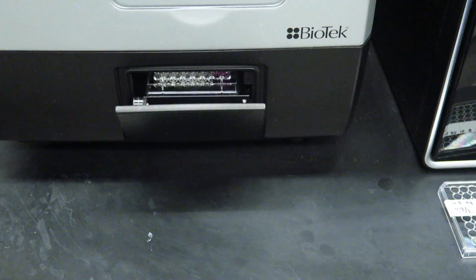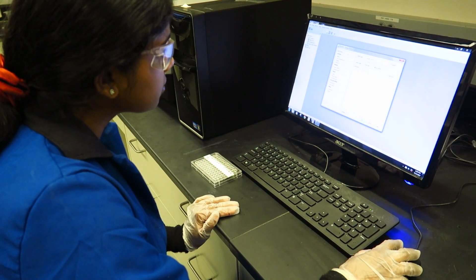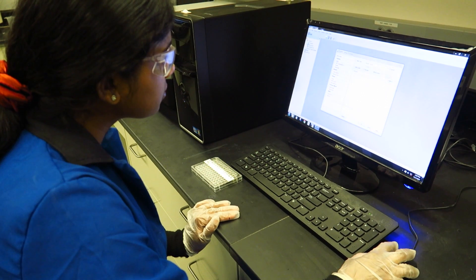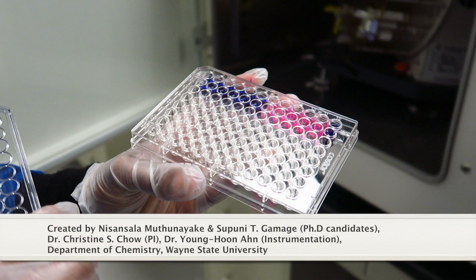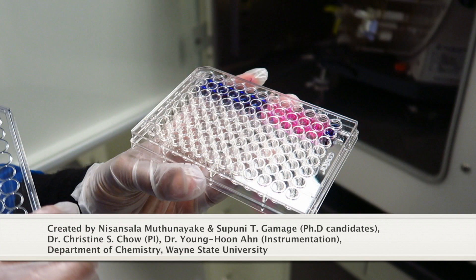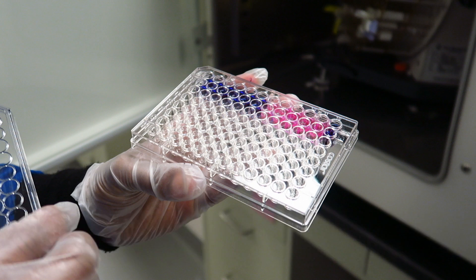For quantification purposes, color can be measured using a plate reader as well. This is a common and simple method to find the minimum inhibitory concentration of a drug.